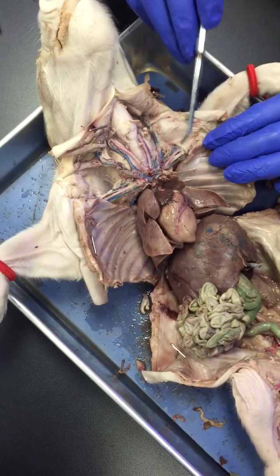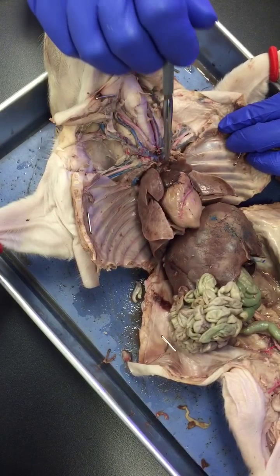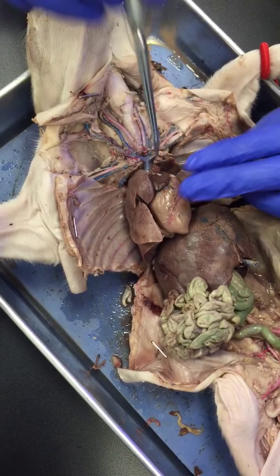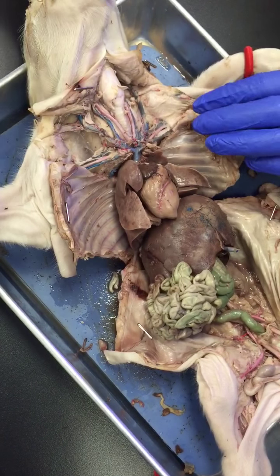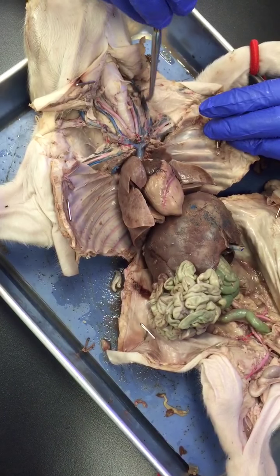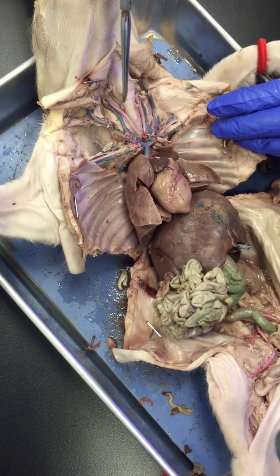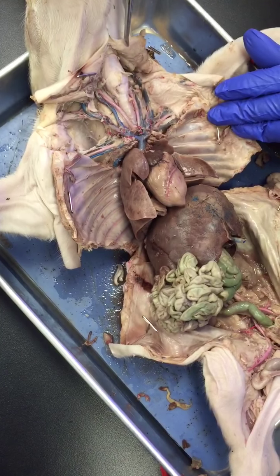Now we have our veins. So these are the left subclavian vein and the right subclavian vein. They're going to join the superior vena cava, this big blue vein, all right? The superior vena cava is bringing back all the blood from the anterior part of the body. Then you have the internal jugular and the external jugular, which are bringing back blood from the head and throat. All right? And that's about it for the anterior part.